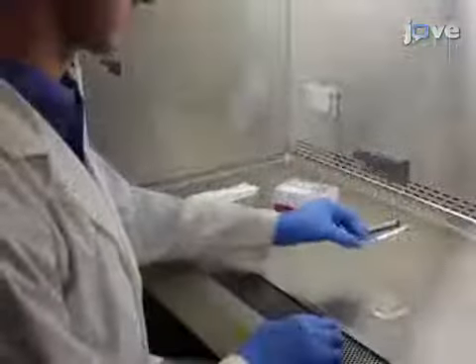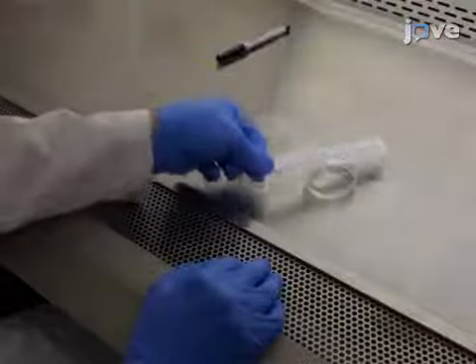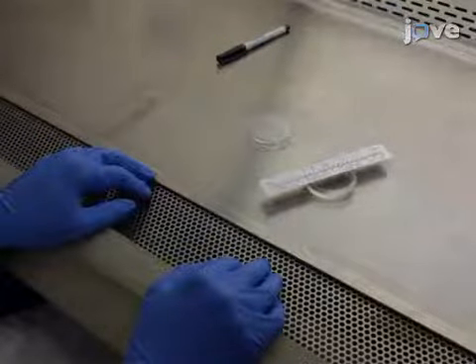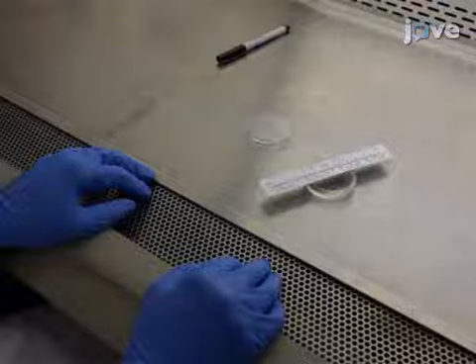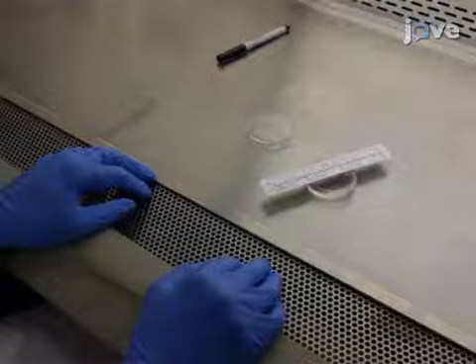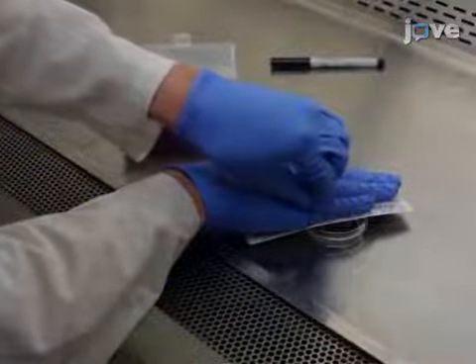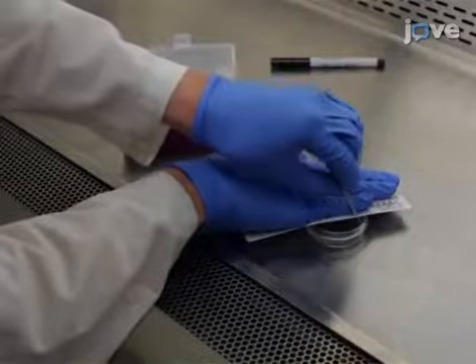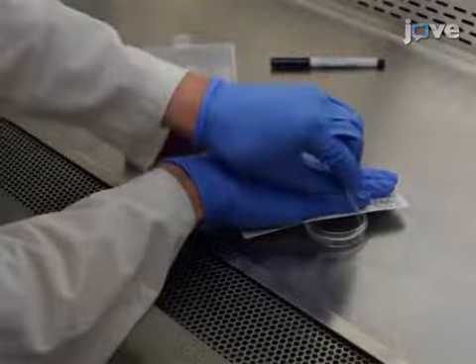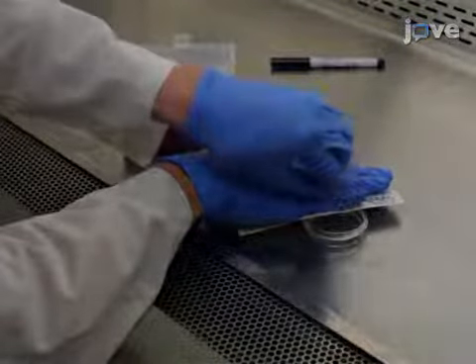In a sterile environment, remove the lid from a plate of damaged MSCs, and lay a straight edge, such as a sterilized plastic ruler, across the top rim of the plate. A straight edge minimizes the amount of rotational adjustments needed for the plate when it is later placed on the microscope stage for imaging. Without removing the media, use a sterile 200 µL pipette tip guided by the sterile straight edge to make four parallel scratches across the plate, approximately 5 mm apart and 50 mm long.